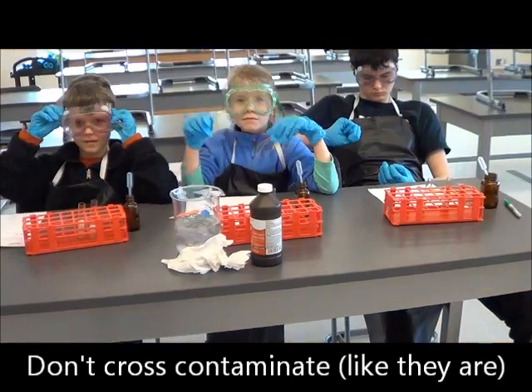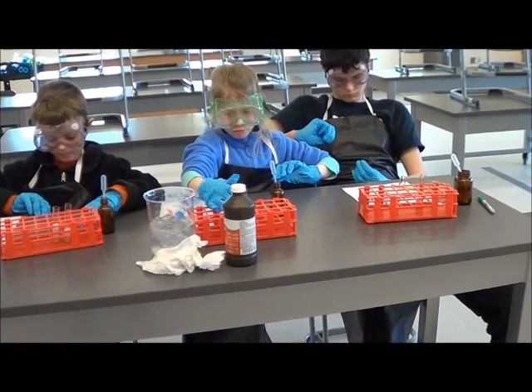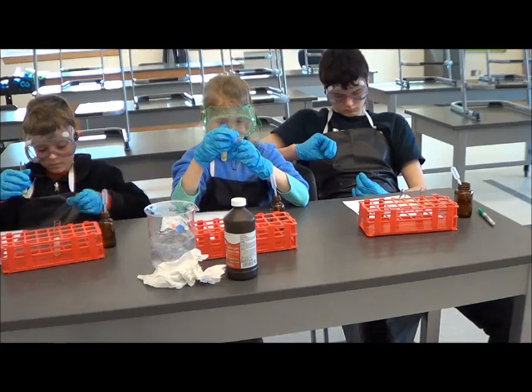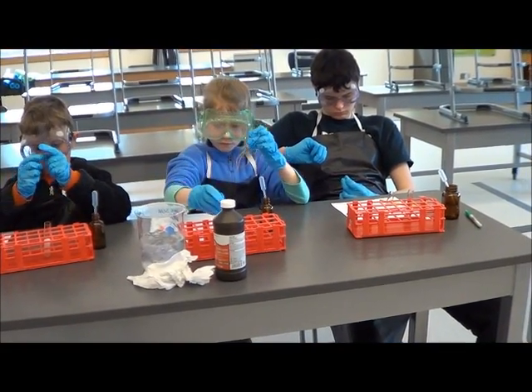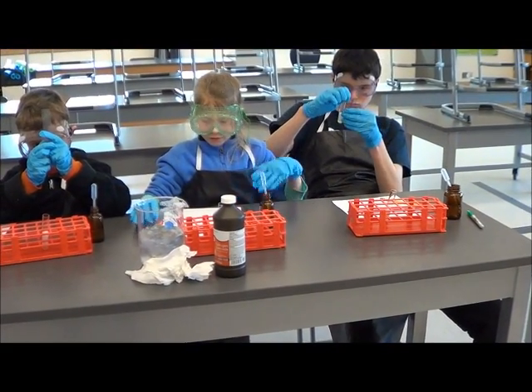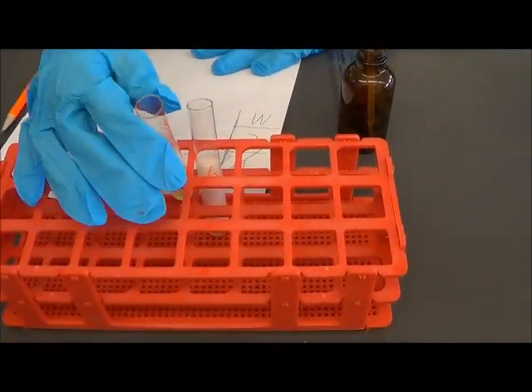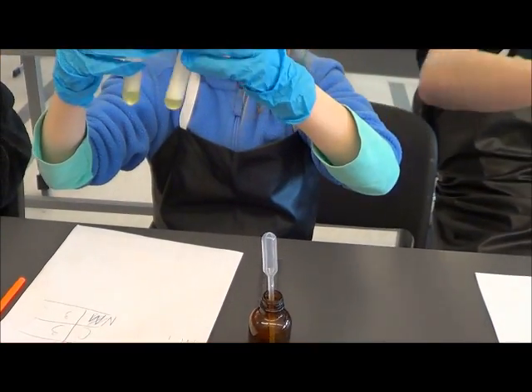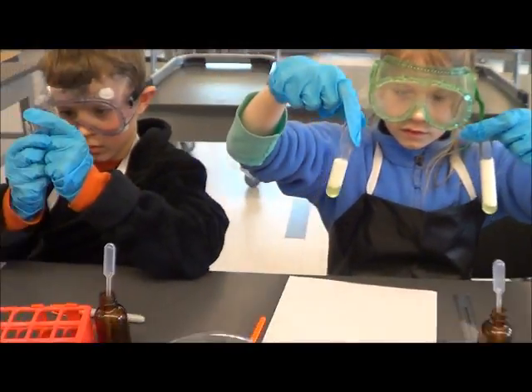Another minute. There's a lot of waiting in this lab. Go ahead and measure now — your cold one. You're going to measure, science helper? Measure your cold one. It's from the bottom up. Which one's the cold one? This one. And can you hold the other one up? Which one's taller? This one, because it's been way taller. Beautiful.